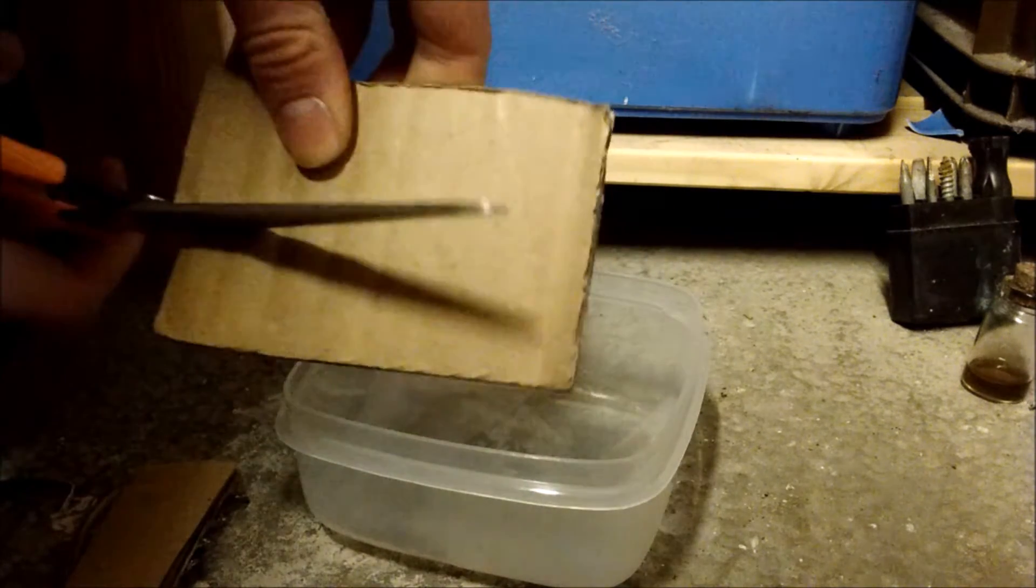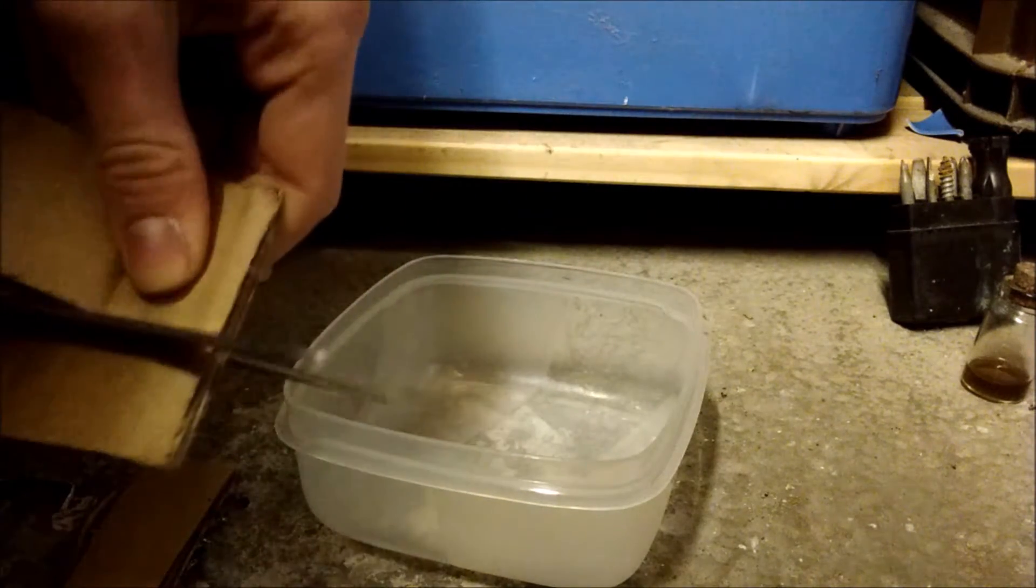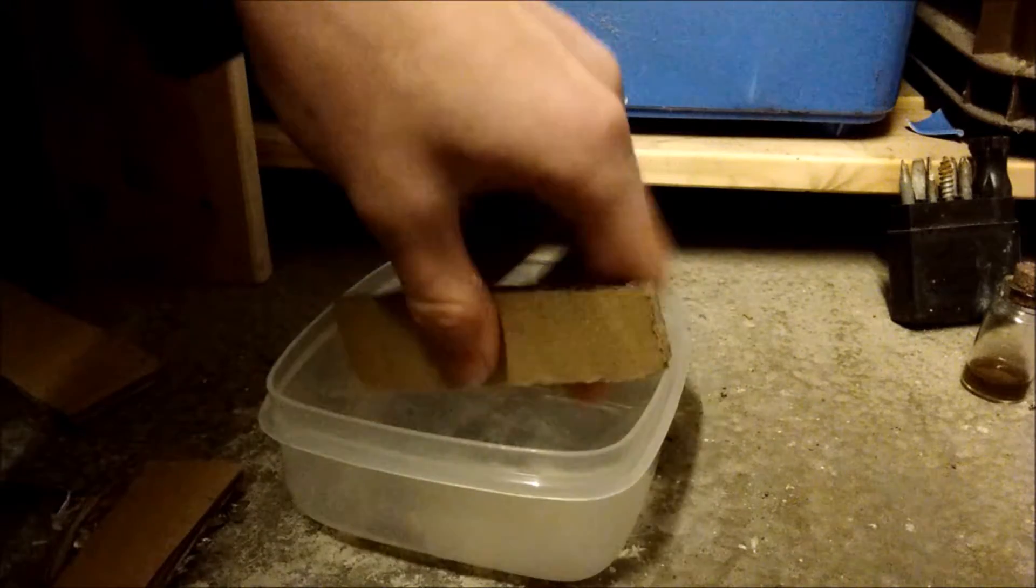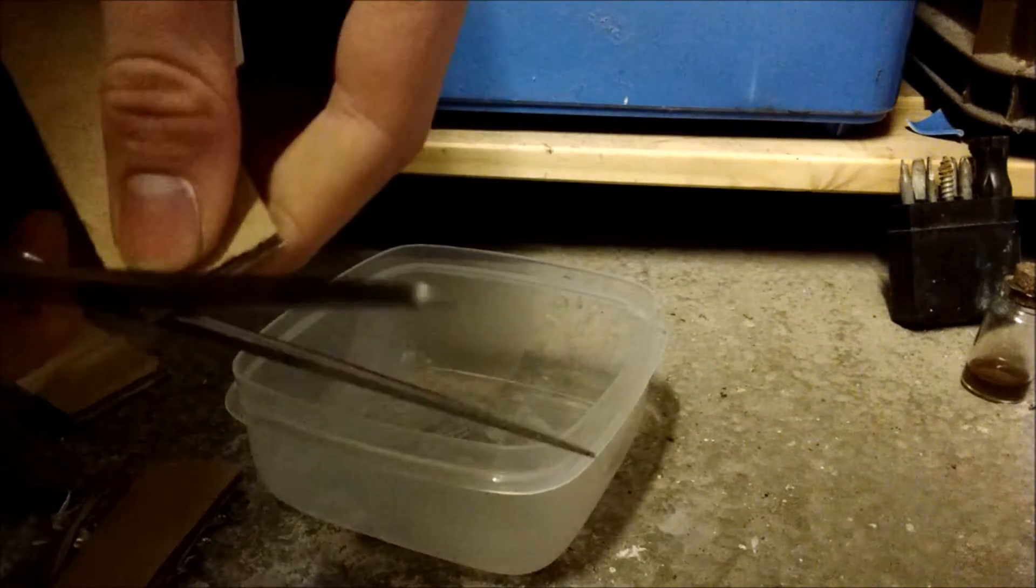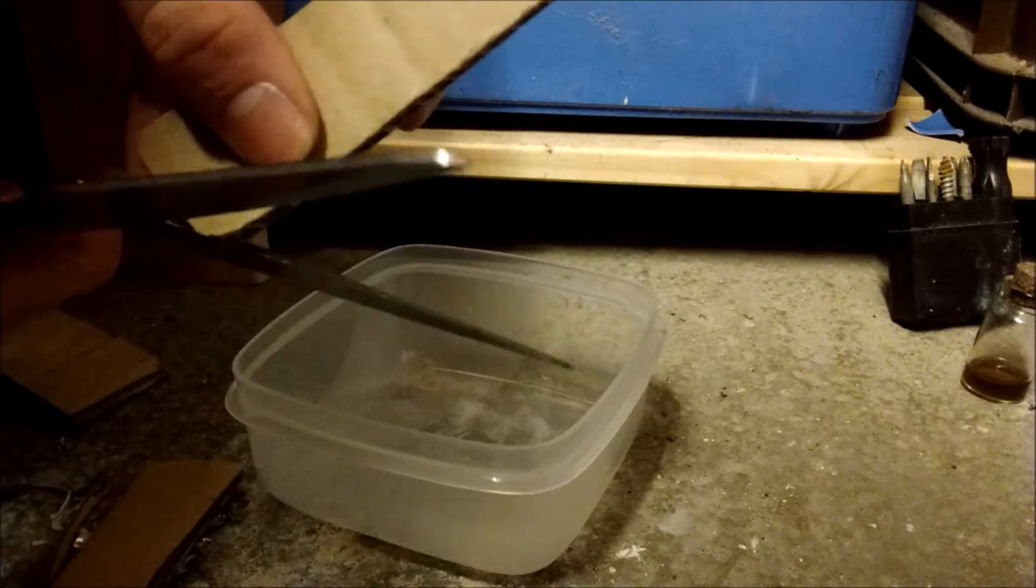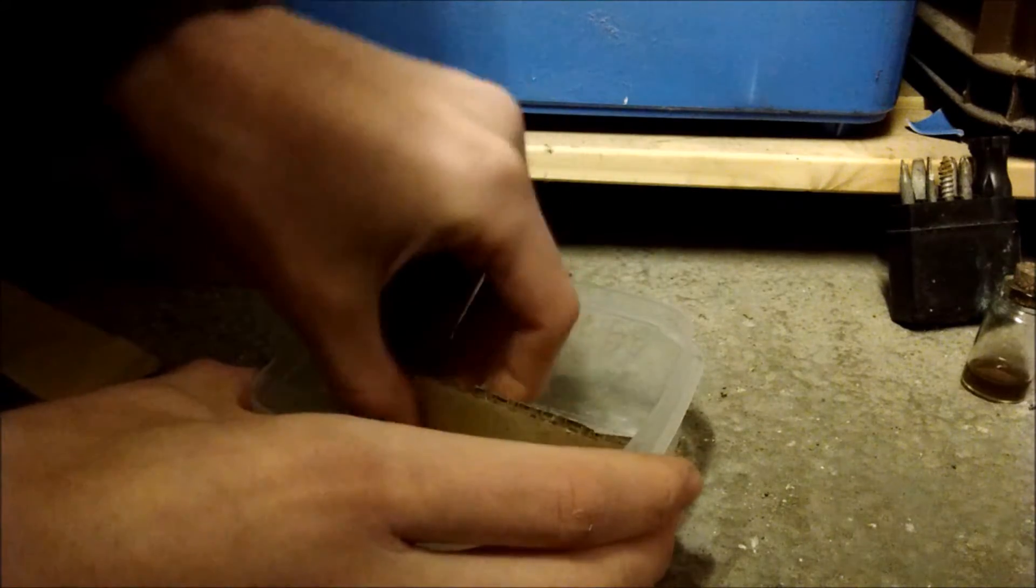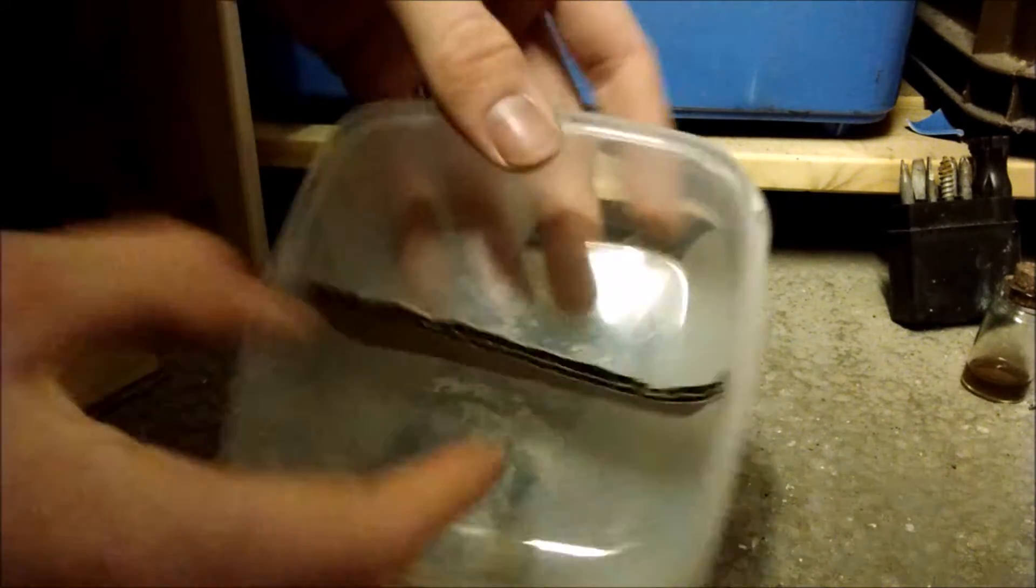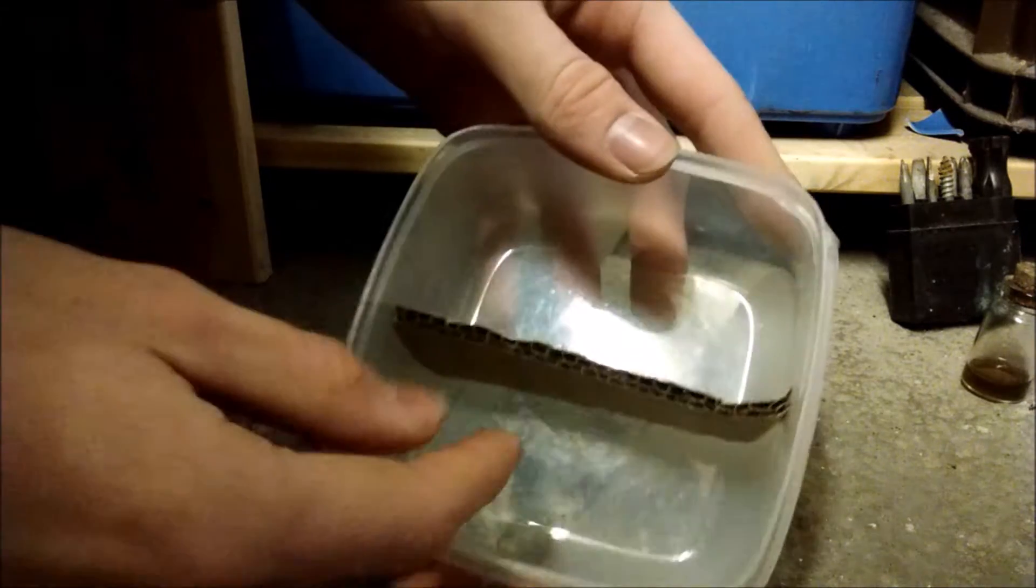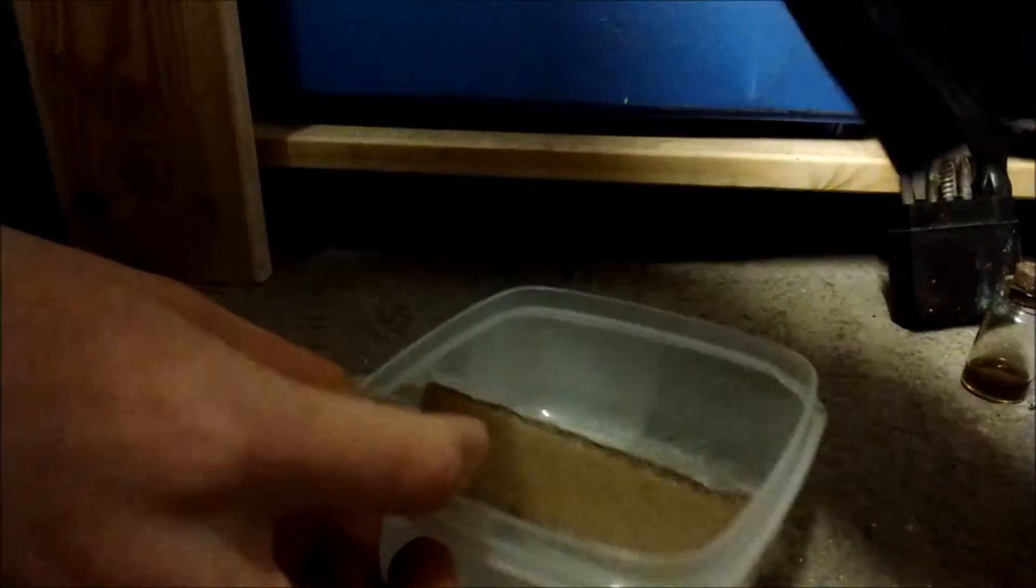And then you want to cut off the top portion of it, because you don't want this to go right up to where the lid is, and just cut down the corners, because mine is slightly curved in the way it's made. So that will fit down in there, right across the middle, it doesn't have to be particularly amazing.